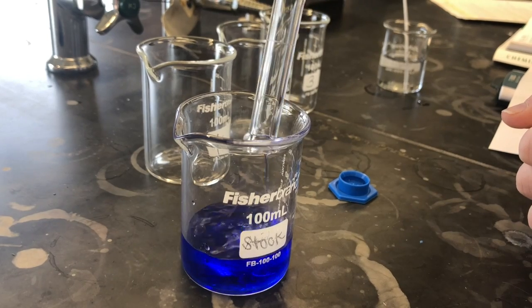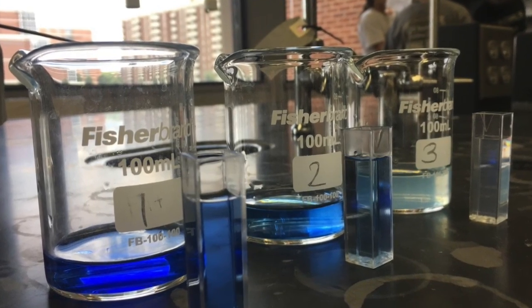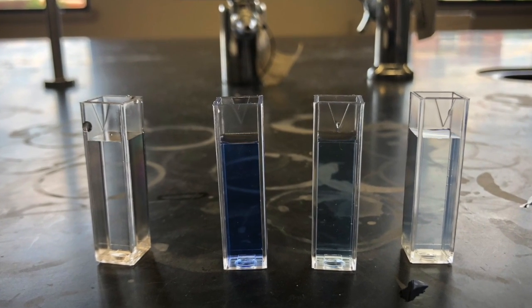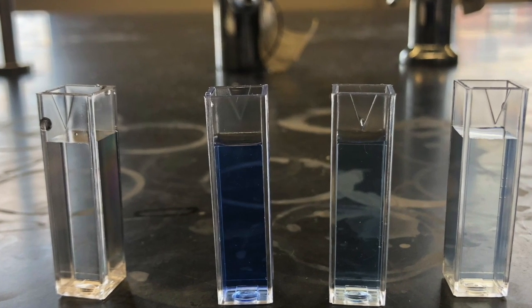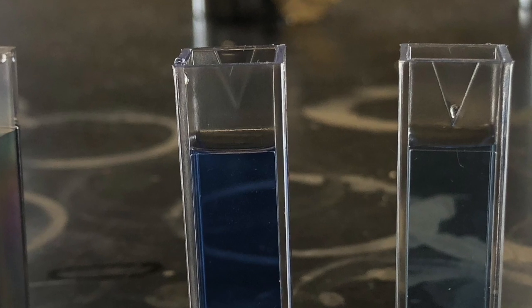After making a stock solution and set of dilutions, transfer these into cuvettes using a transfer pipette. Also transfer water into one of them as a blank. Fill them up to the line marked on the cuvette so it will scan properly in the spectrophotometer. Make sure you have a system to remember which dilution is in which cuvette.